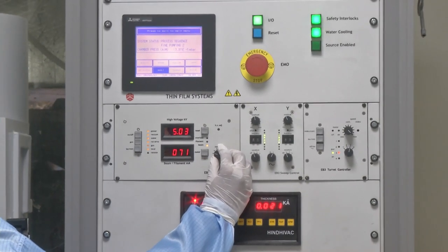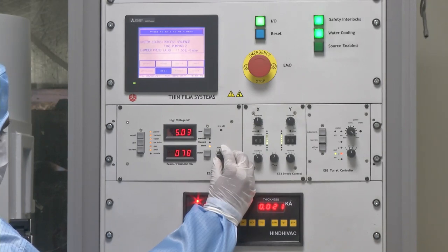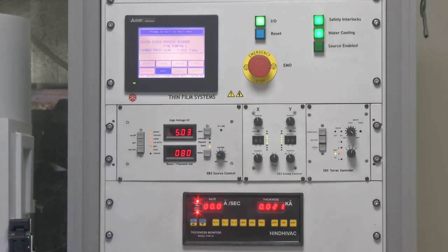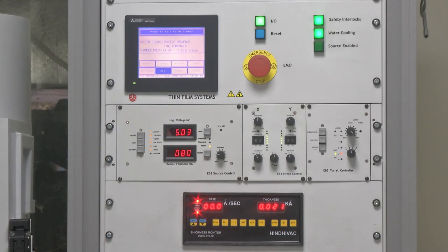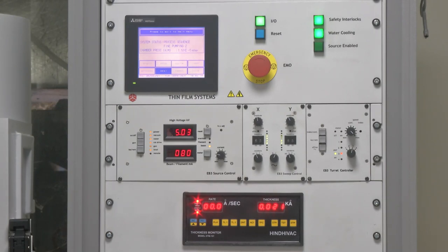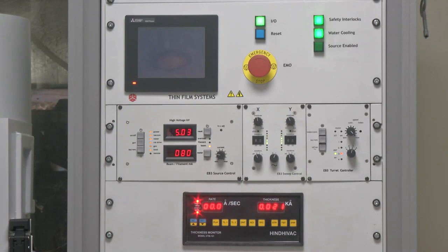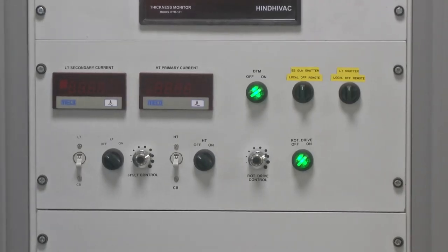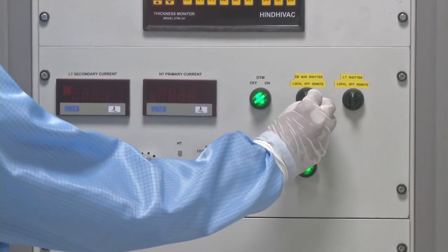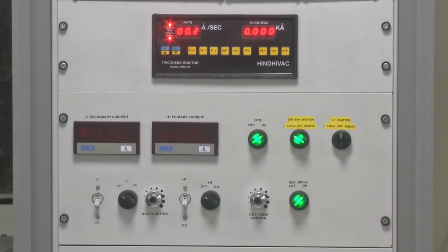Now we are going for the final rise and soak cycle — after this, actual deposition will begin. An important thing to keep in mind is that during all rise and soak steps, the shutter must be closed; otherwise, different kinds of spots and non-uniform deposition will appear on the substrate. Once the final soak is done, we open the shutter by pressing the knob, and the deposition starts.